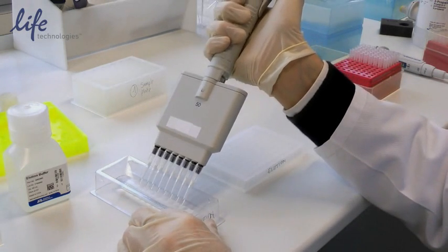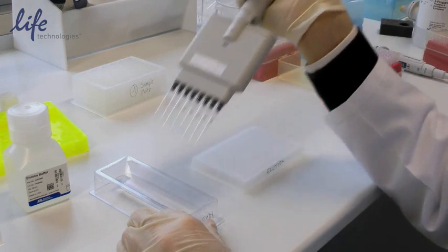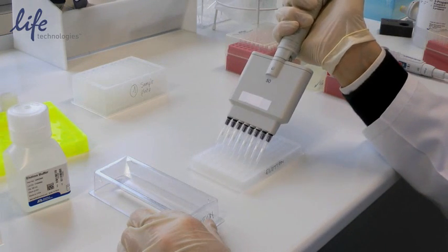In this case we're going to use a low volume plate because at the end of this procedure the elution volume is where we'll have concentrated all of our RNA and DNA.